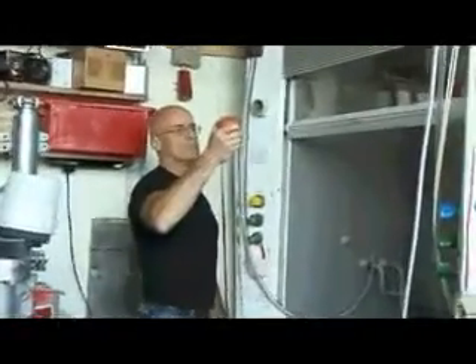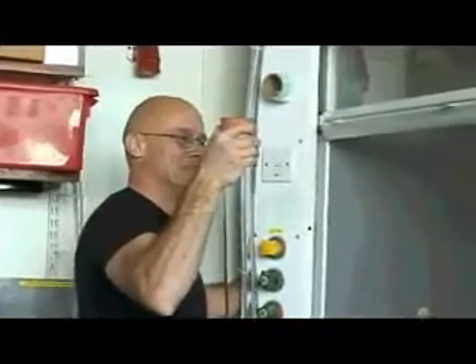So Neil, I'm preparing for one of our favourite reactions. It's called the Barking Dog reaction. This is a reaction which actually makes an element, and we're going to make some sulphur today. The reaction's quite cool.